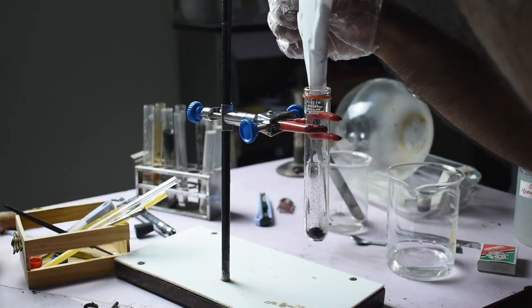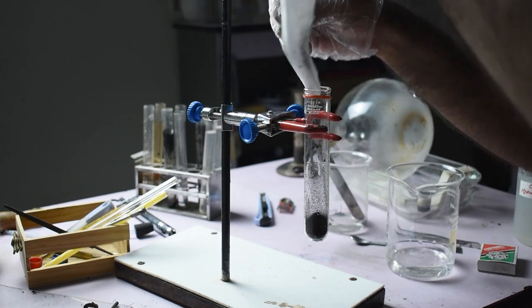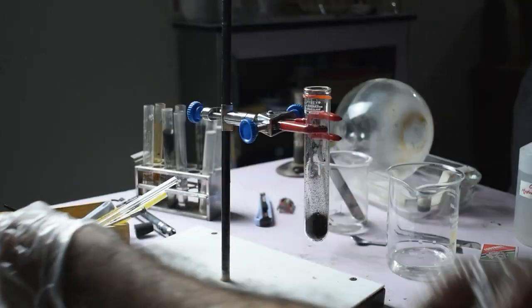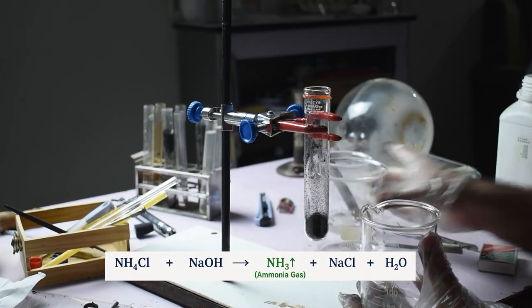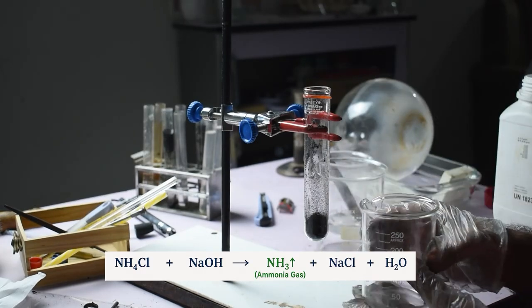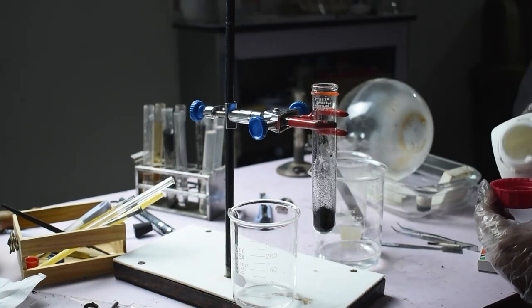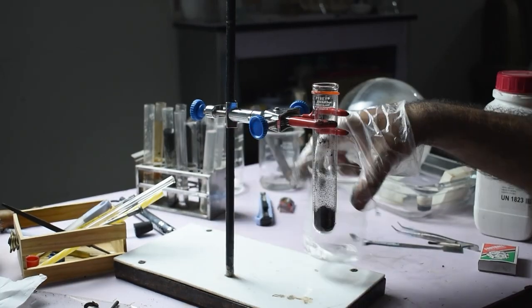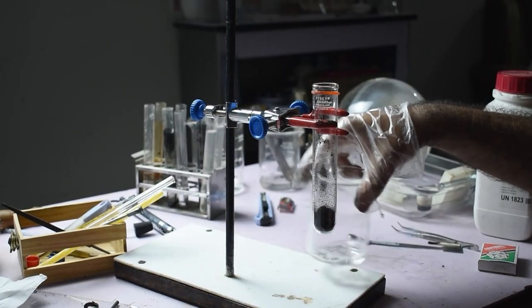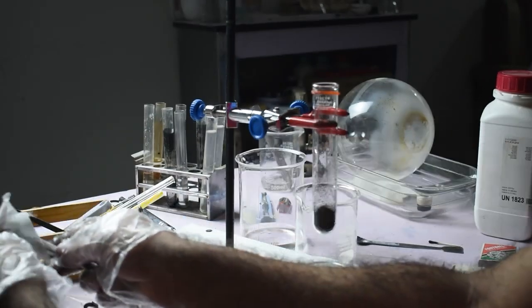Finally, we come to the most interesting part of the experiment, the production of ammonia gas. The black paste inside the battery contains ammonium chloride. When it reacts with sodium hydroxide, ammonia gas is released. First, sodium hydroxide pellets are dissolved in distilled water. This dissolution is highly exothermic, producing enough heat that no additional heating is required for the experiment.